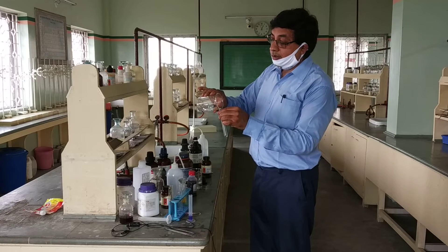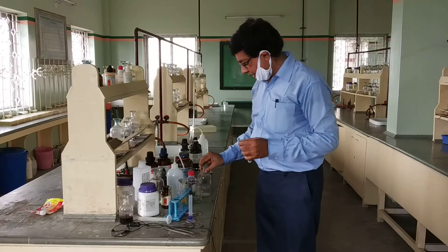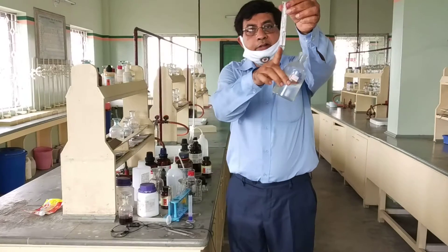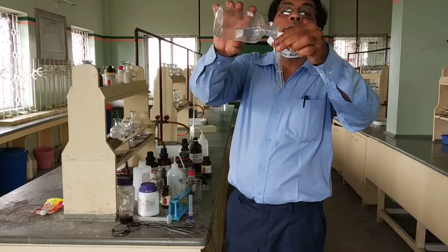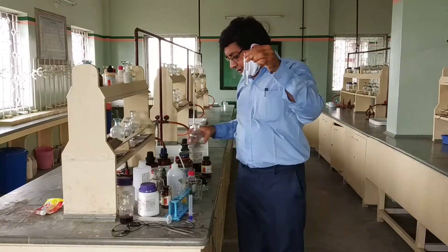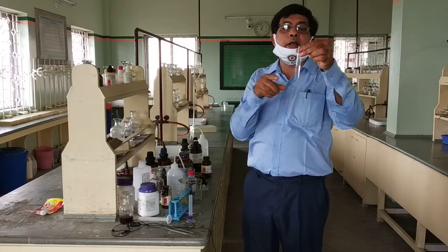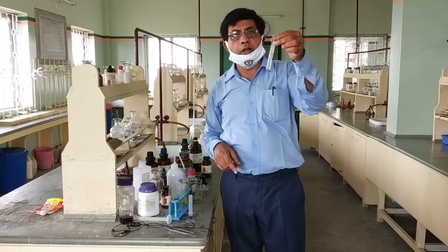Another test: you take the sample solution and add sodium bicarbonate solution, NaHCO3. All types of carboxylic acids evolve CO2 gas. You observe effervescence — some gas is evolved. This is the effervescence of CO2 gas. Acetic acid reacts with sodium bicarbonate to produce sodium acetate, water, and CO2 gas. This CO2 gas bubbles out, which is known as effervescence. Effervescence of gas confirms the presence of the carboxylic group in the compound.